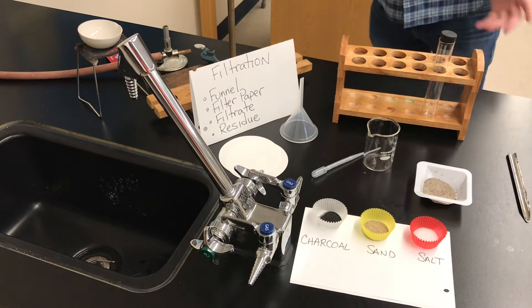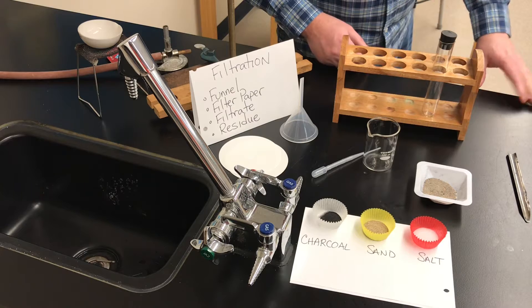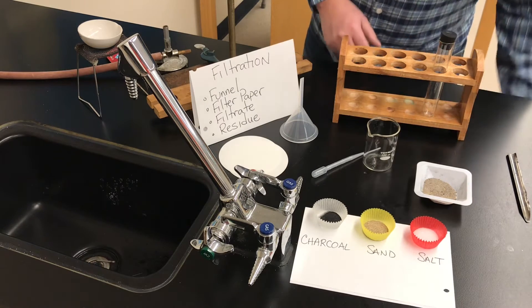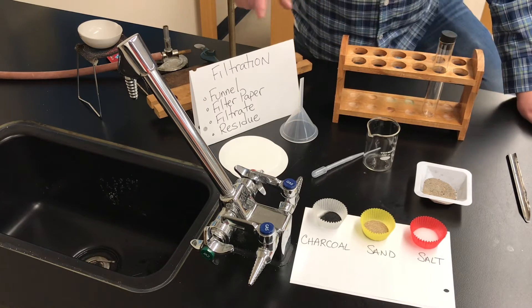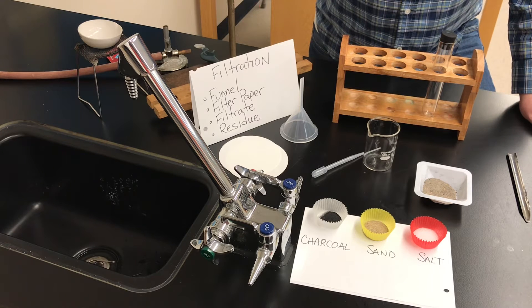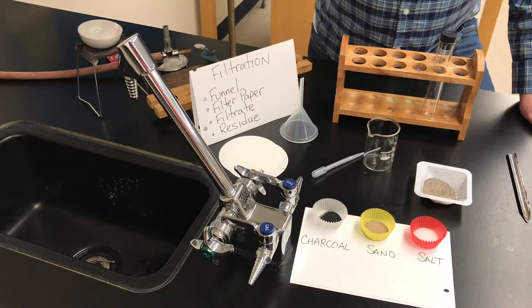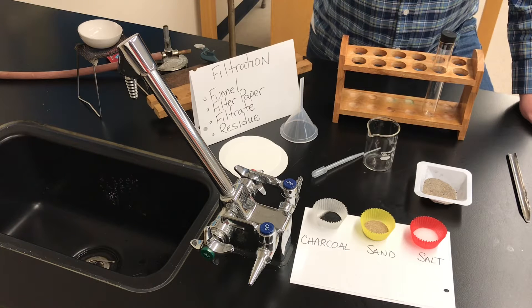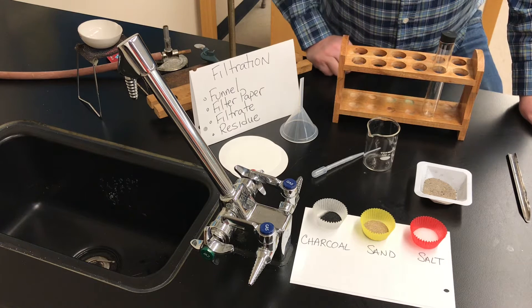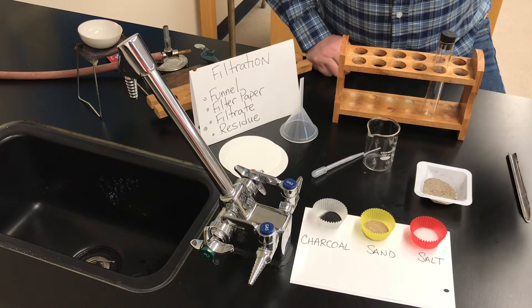In today's video we're going to take a look at how to separate the components of a mixture of solids using a new technique. For grade 9 advanced science we're going to learn how to filter something, and we're also going to talk about evaporating. This is for students who are going to miss an experiment that we would normally do at school.